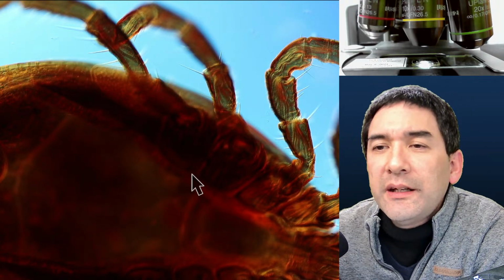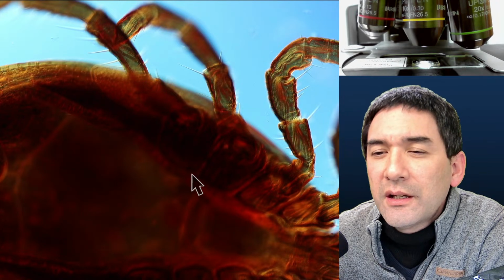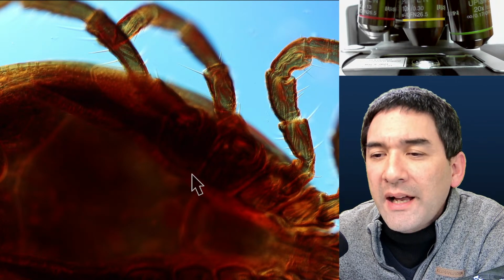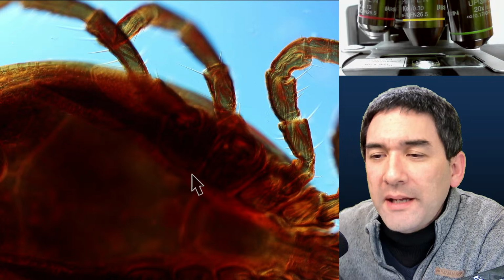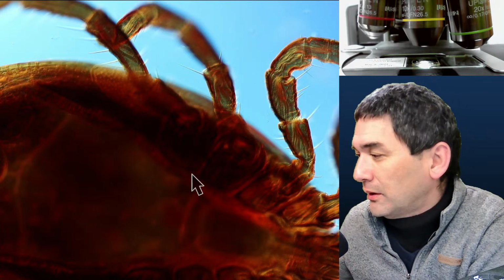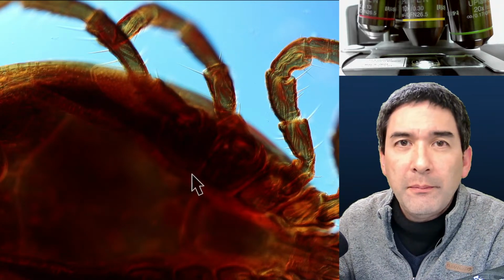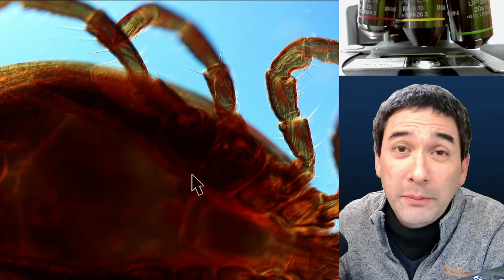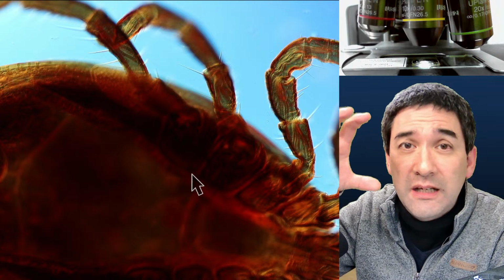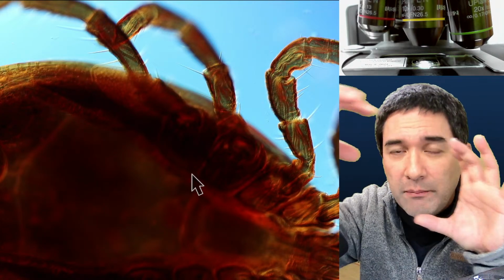Every now and then I skip over to the questions. How do compound eyes work? Well, basically, ticks don't have them, but maybe I'm going to be able to show you a better example later on. They are pretty complex structures, but what they have are individual light-sensitive elements that are arranged in a pattern.